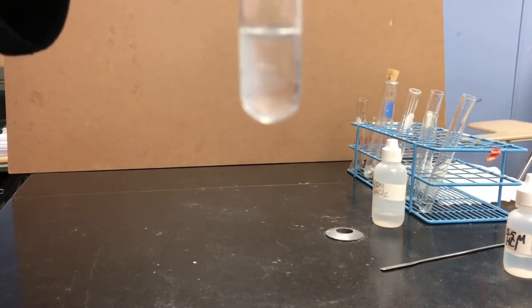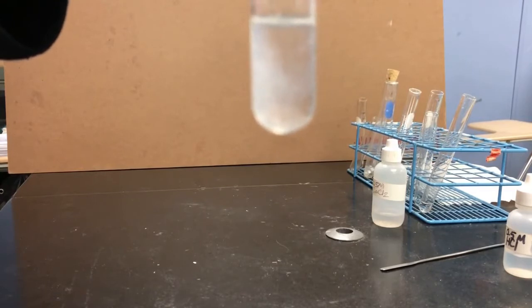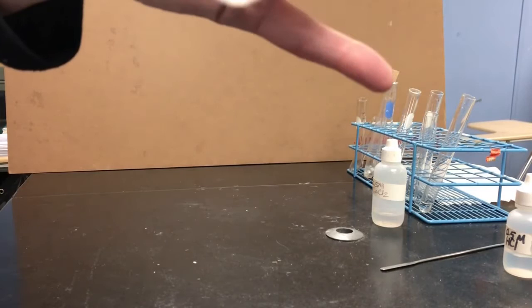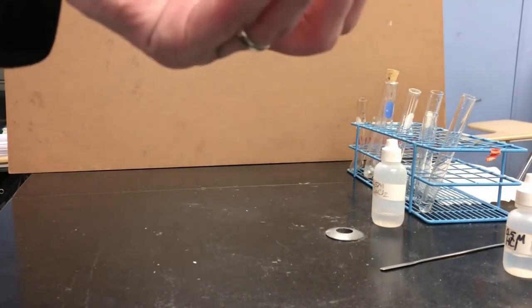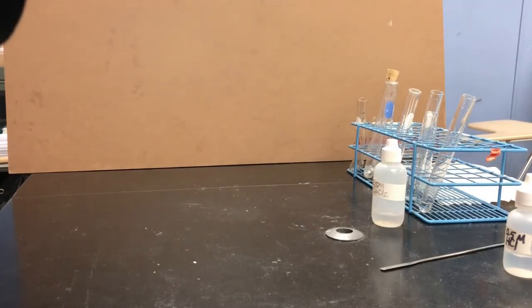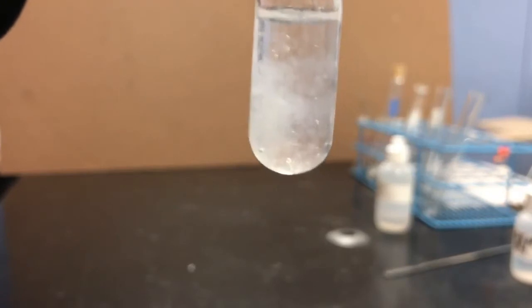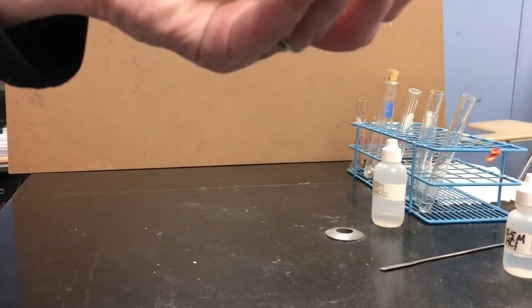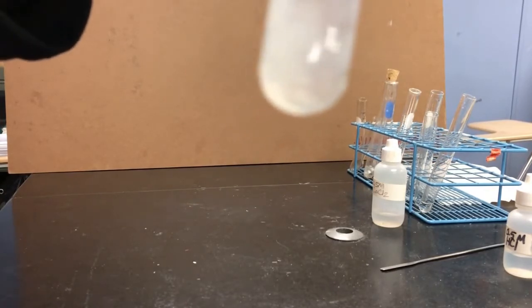Now, it's not immediately obvious. It does seem to be changing color. It looks a little cloudier than it did before. It doesn't look totally clear like water does. Also, it just feels a little chunky, like when I'm dripping additional sodium phosphate into the container, it's not splashing as much as I'm expecting to.